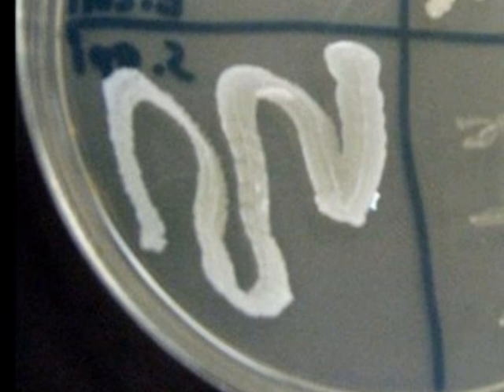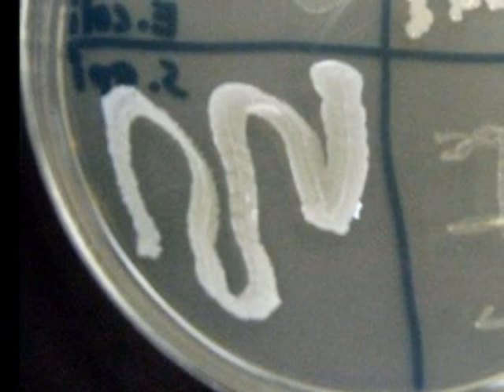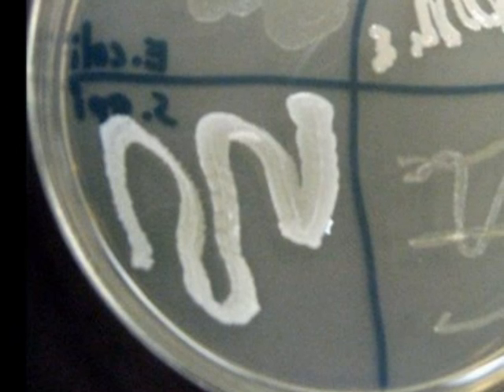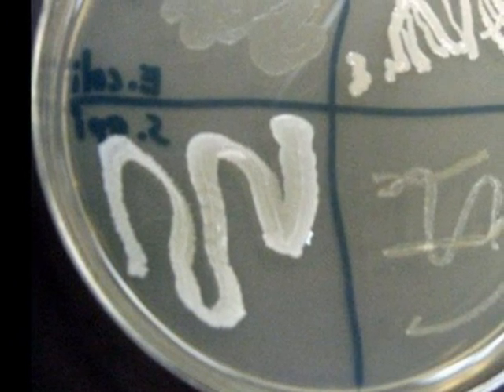You can see that several microbes have been used in inoculating this medium. Good growth can be seen in the lower left and upper right-hand quadrants. Poor growth, that is mostly inhibited, can be observed in the upper left and lower right quadrants.